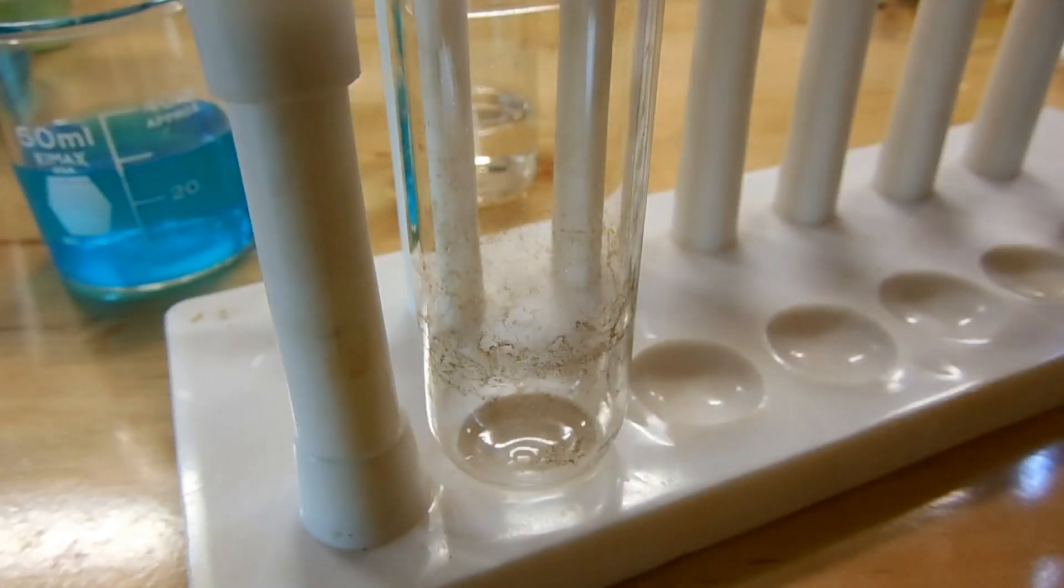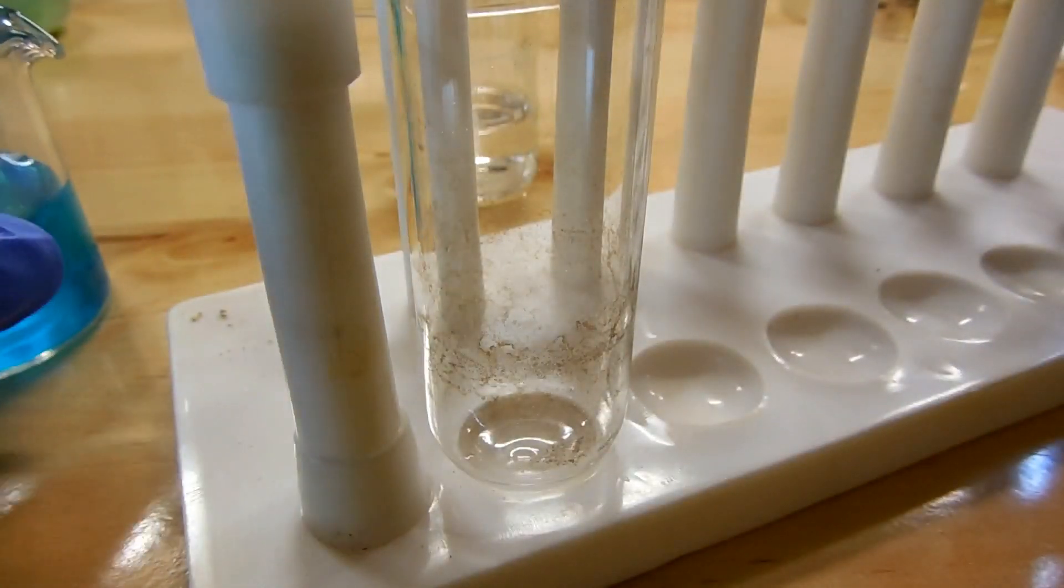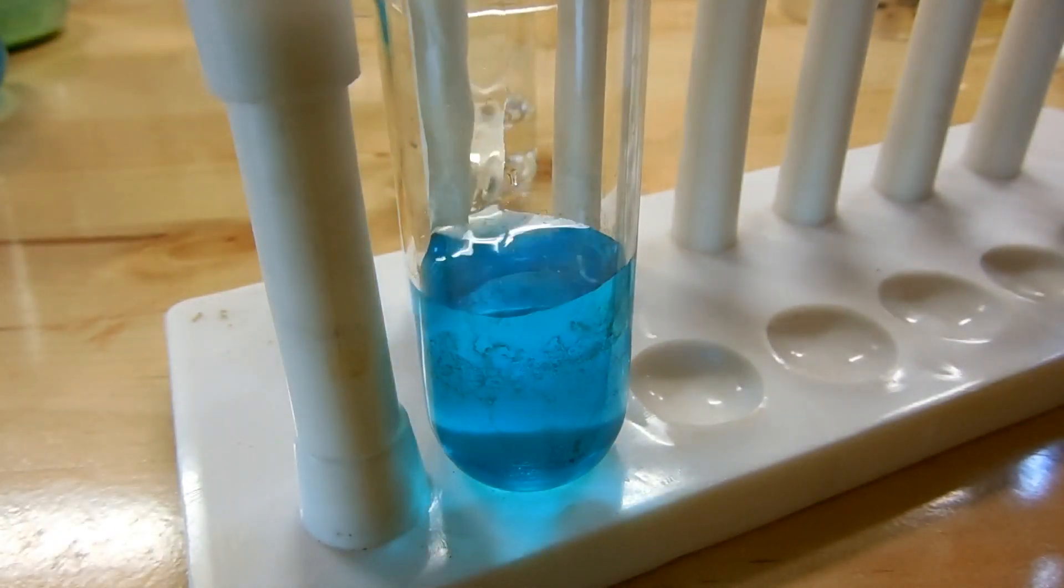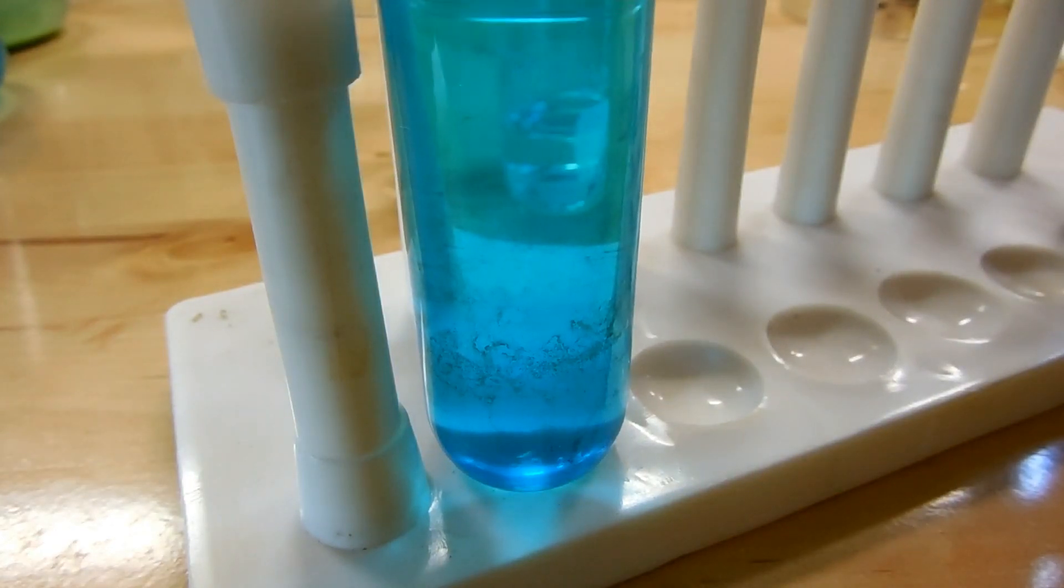Alright, we've got things dissolved now, and I'm going to transfer them into a large test tube. So first the copper sulfate solution. This test tube is a little dirty, but they're just carbon stains, so it's not going to really affect anything.